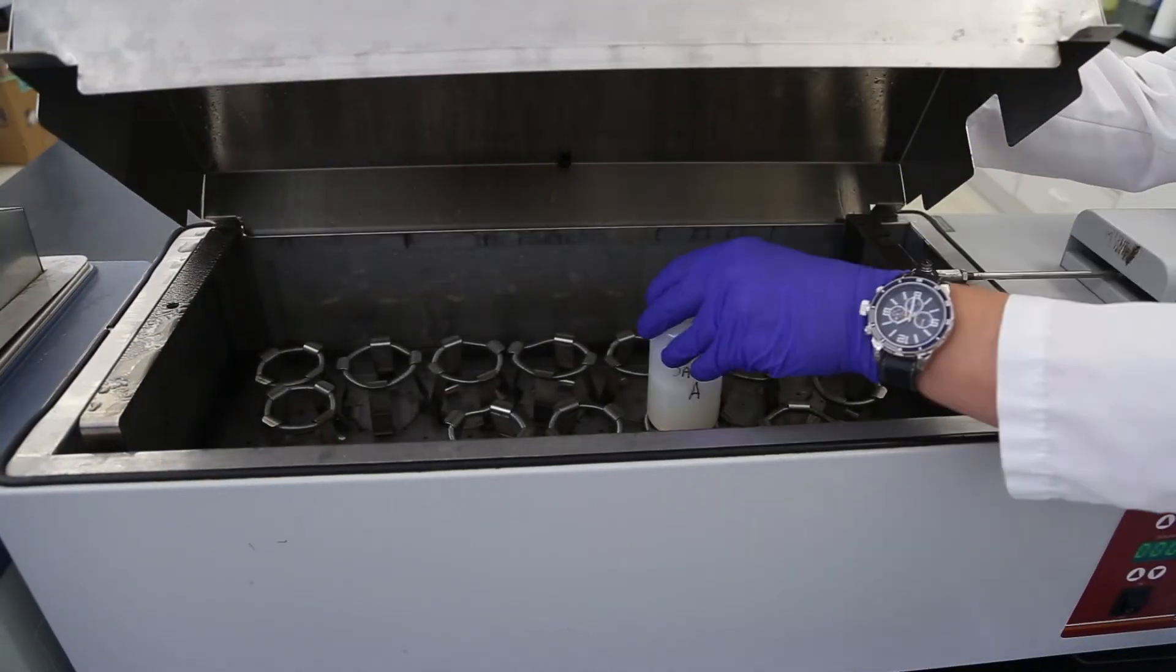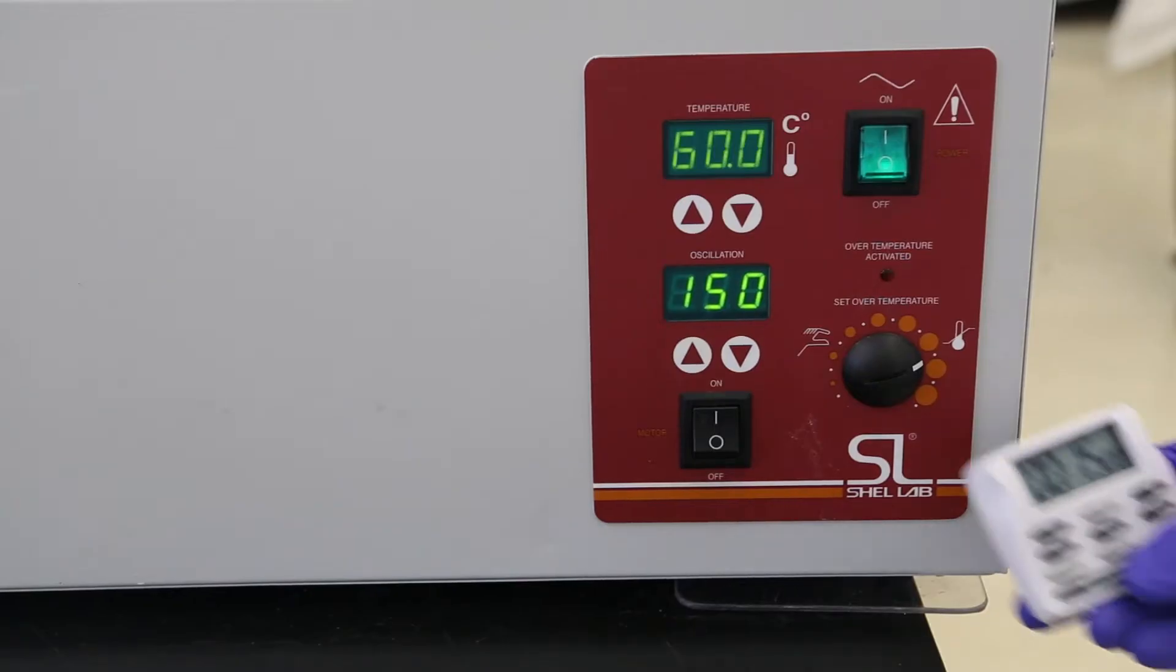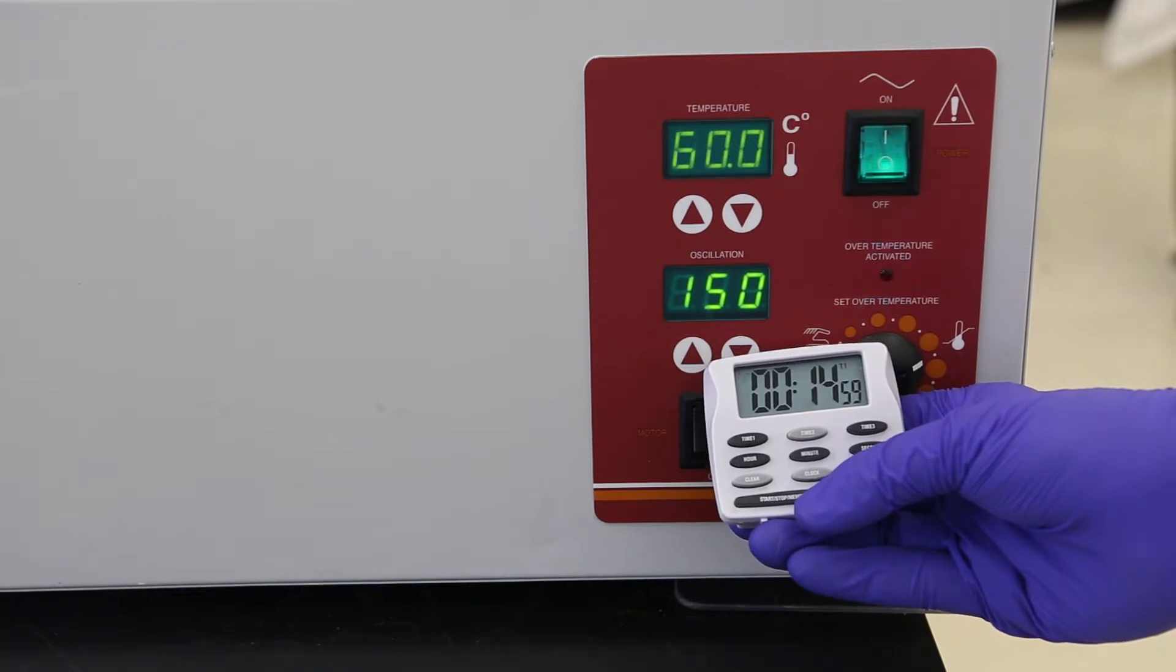Extract by shaking in a 60 degrees Celsius water bath at 150 RPM for 15 minutes.